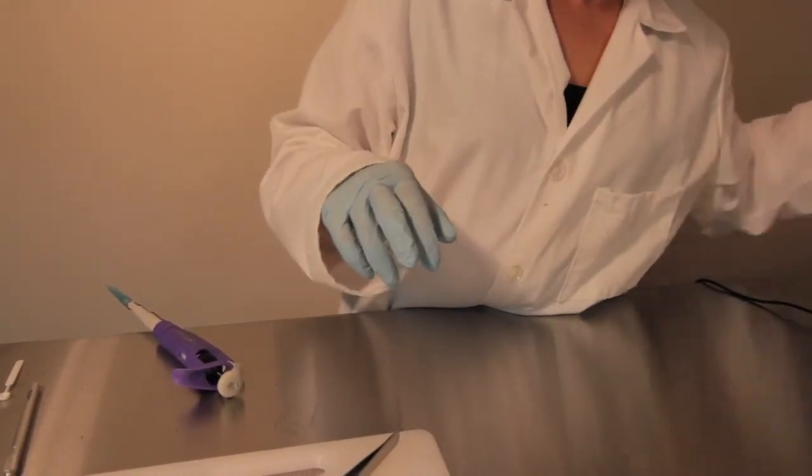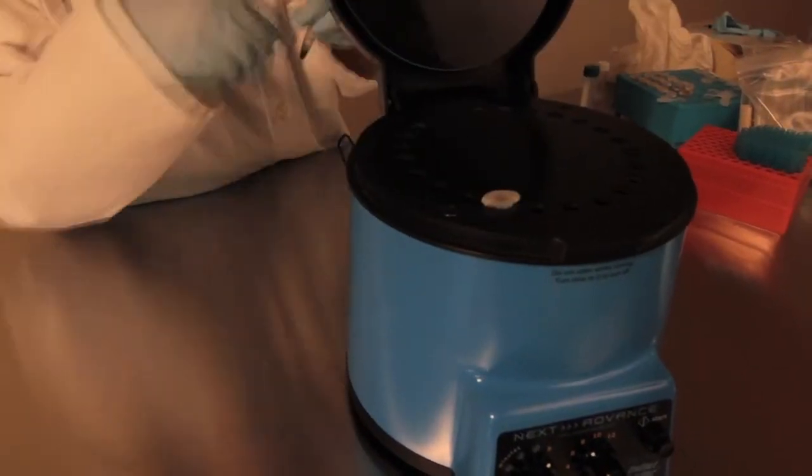Now it's time to make sure that your tubes are sealed tightly and place them evenly spaced inside of the bullet blender.